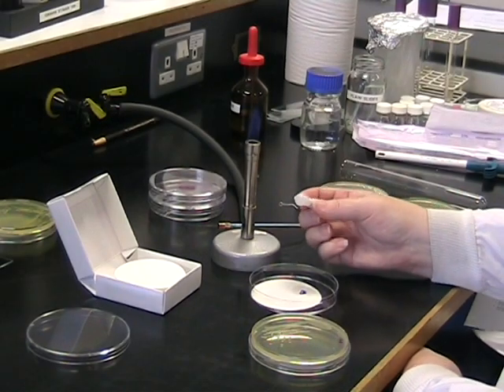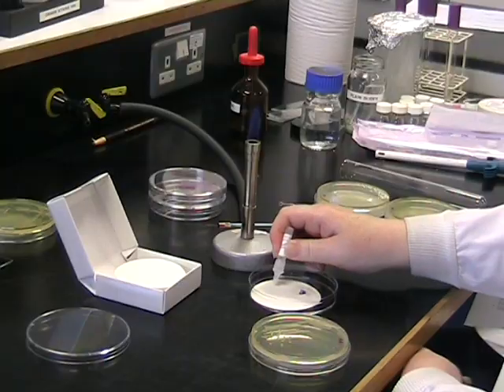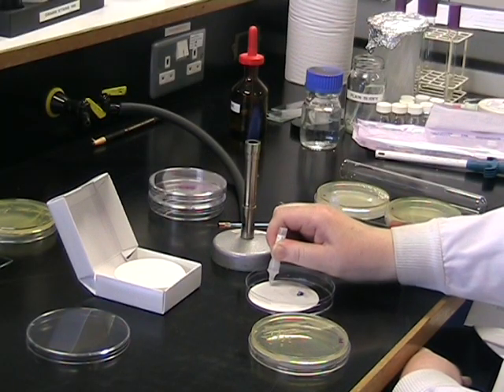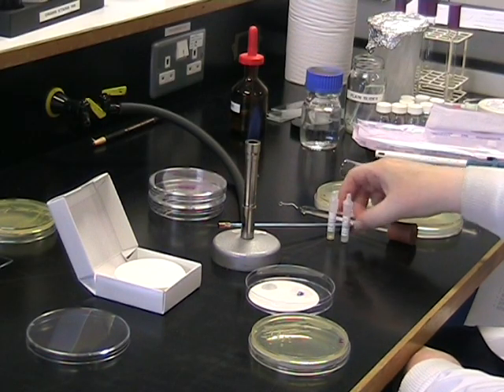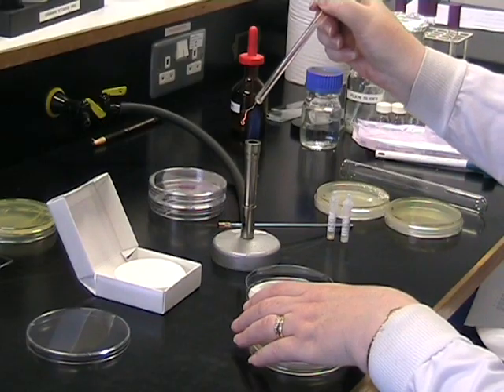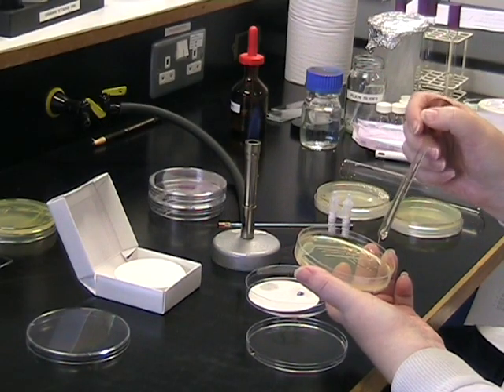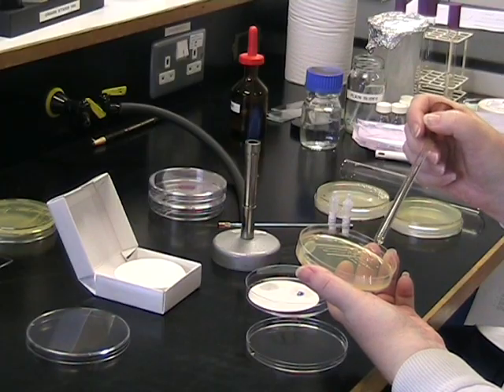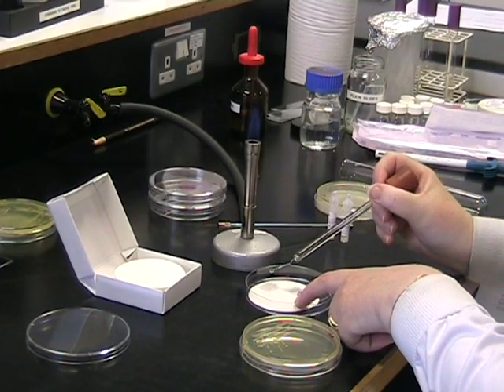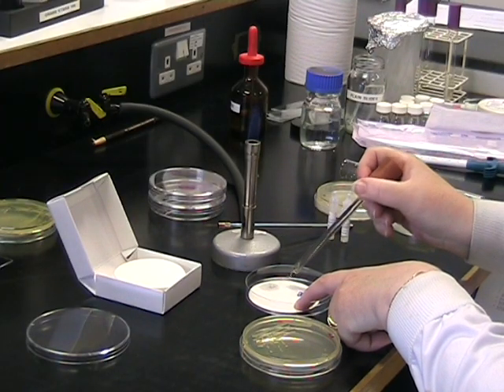We're going to repeat the test now using a known negative control. Put another drop of reagent onto the filter paper. And using a plastic or a platinum loop as before, take a sample of your organism. Remember to take a generous sample onto your loop. Rub this, as before, into the reagent.